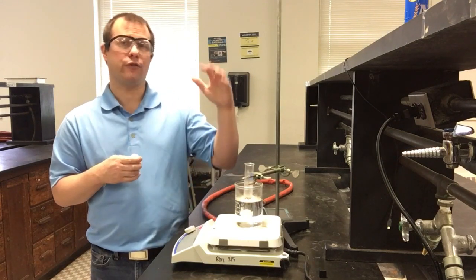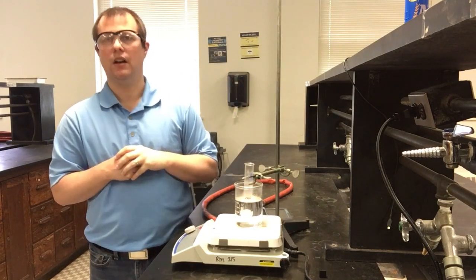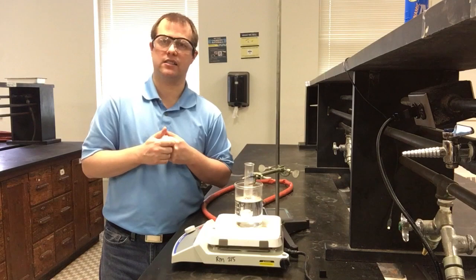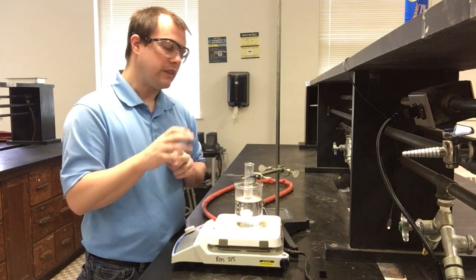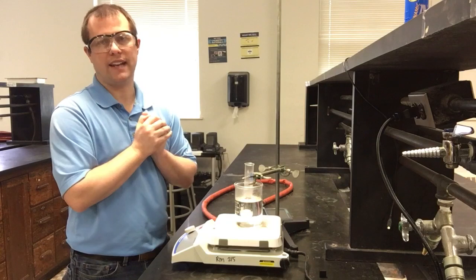For the first trial, I'm going to record everything, and you can watch everything cool down. I'll show a zoomed-in look at it as it's happening and point out when crystals are forming and things like that. I'll also have the actual data that you can look at as an Excel file for this trial and the others as well. We're just going to see where everything freezes. Visually, we'll probably start to see some crystals form before freezing happens.